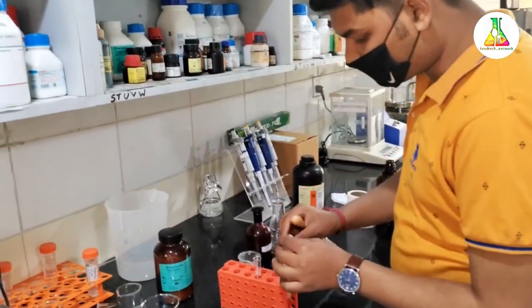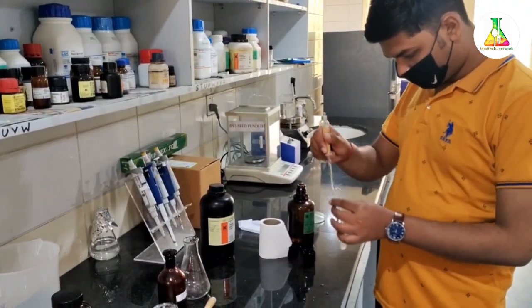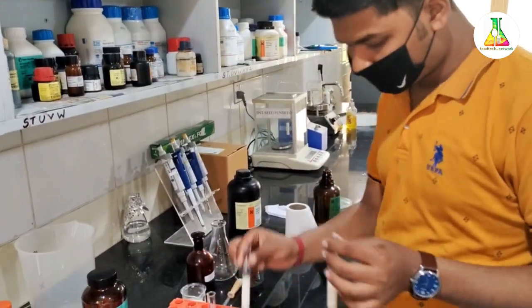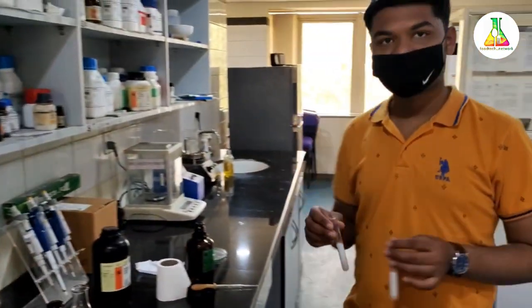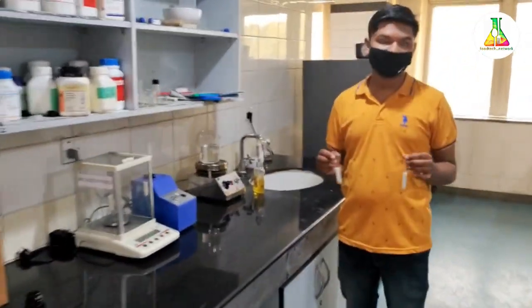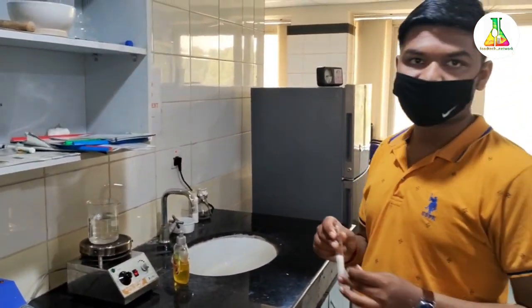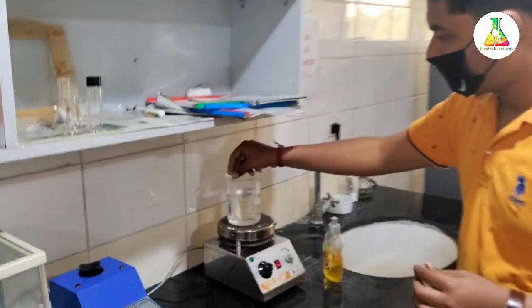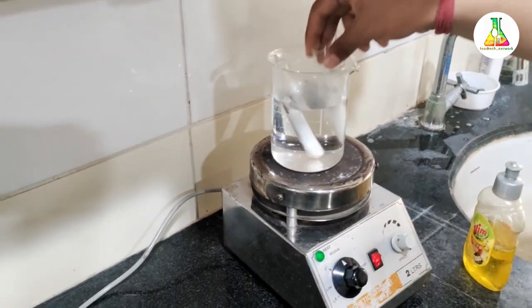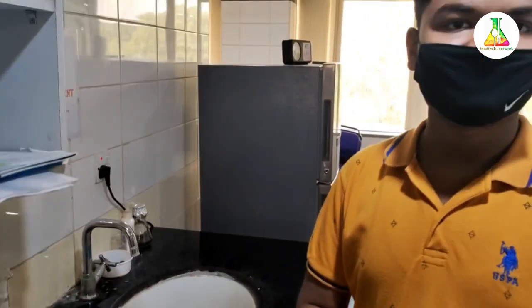I have added the concentrated acid using the dropper. Now I will put both test tubes back into the water bath, because as I already explained, this reaction requires thermal energy input. Only under these heated conditions will the color be obtained — if cane sugar or sucrose is present. We will wait for a couple of minutes and observe whether our milk is adulterated or not.